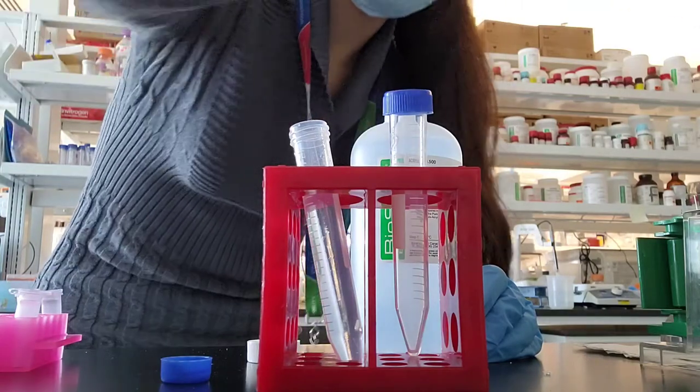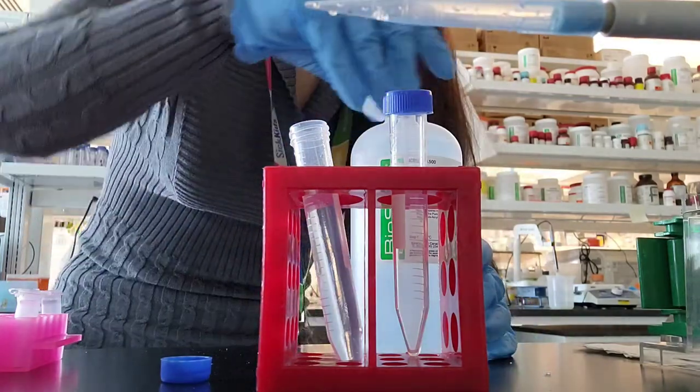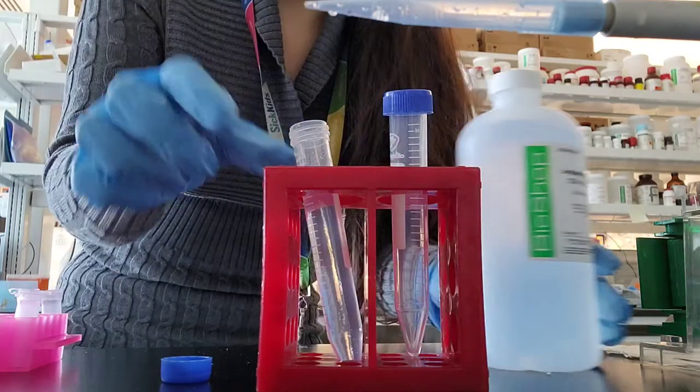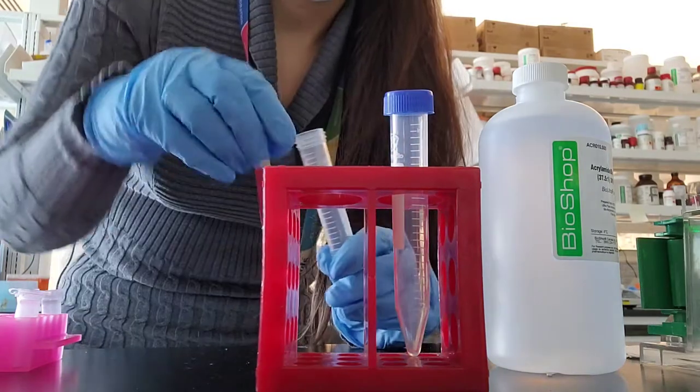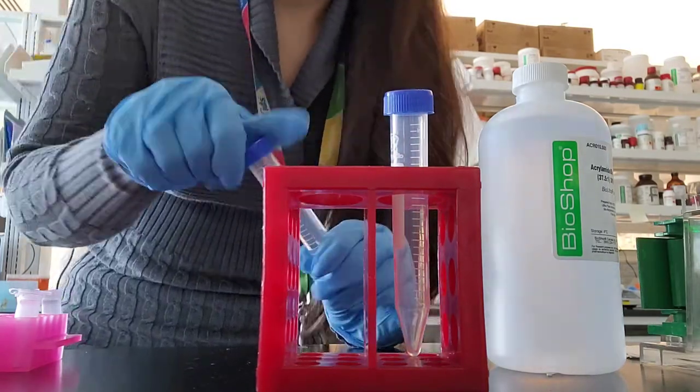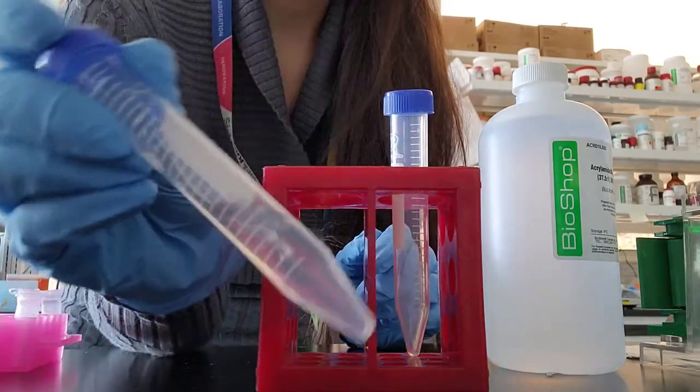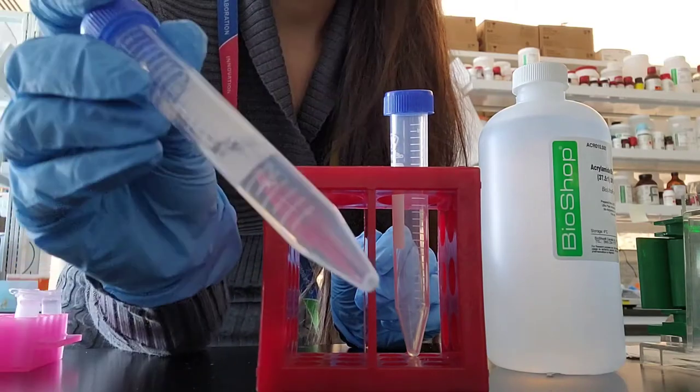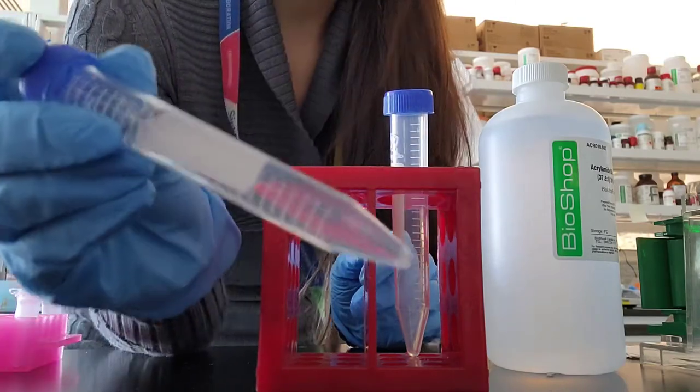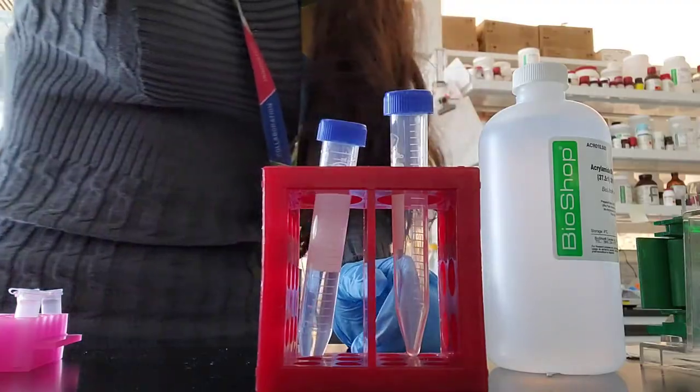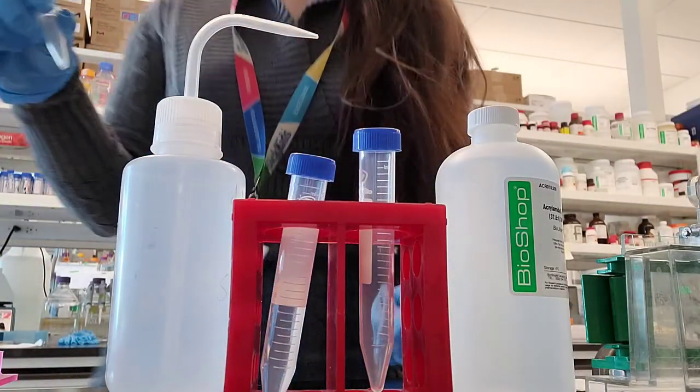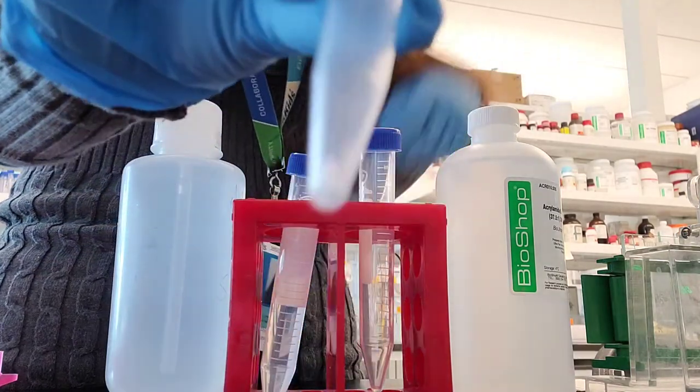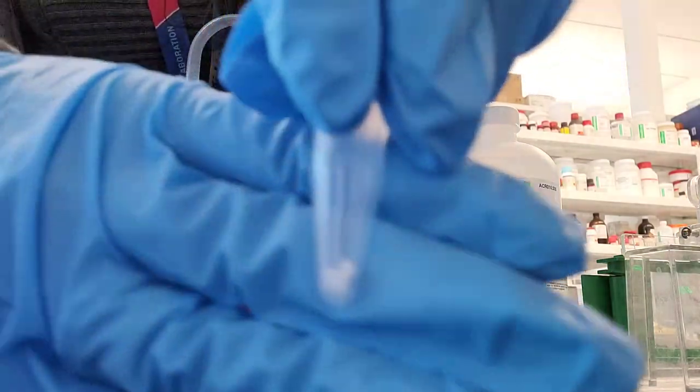The viscous acrylamide solution needs to be everywhere in the solution. Otherwise, if you pour your gel without mixing it well, you might get some inconsistency throughout it and your migration patterns will not be accurate. So definitely give it a couple shakes. Before adding SDS you can really shake it well and it won't make a foam.